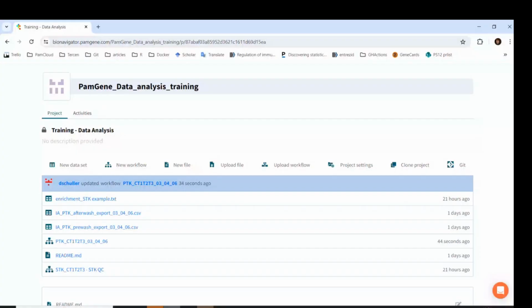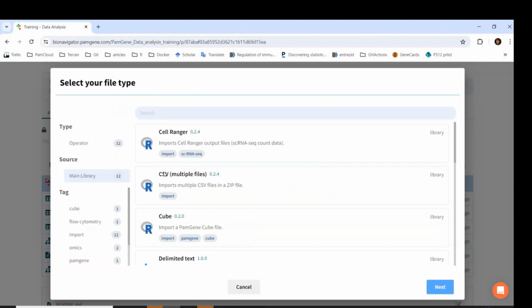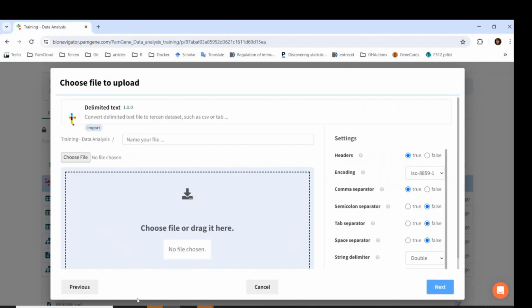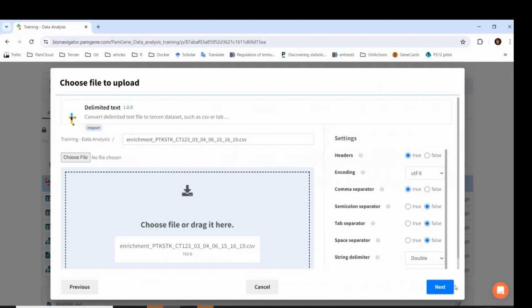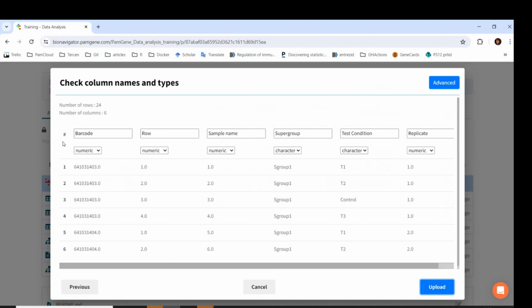Next, let's upload the sample enrichment file to the project. Click on New Dataset, Delimited Text, and Upload. Importantly, you have to check if the columns have the correct type. They can be numeric or character. There are two reasons why they have to have the correct types. One is for joining two data tables. They can only be joined on a column if they have the same type.